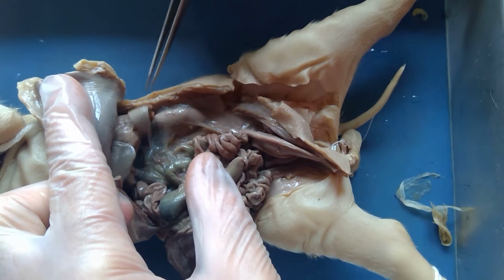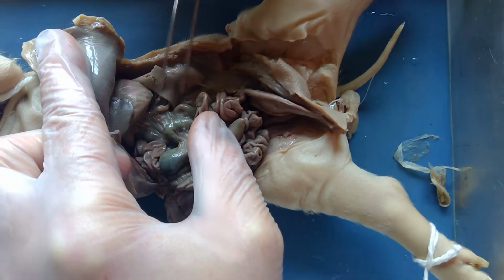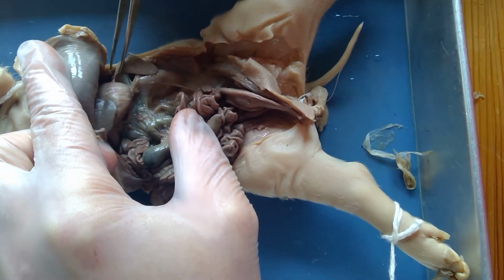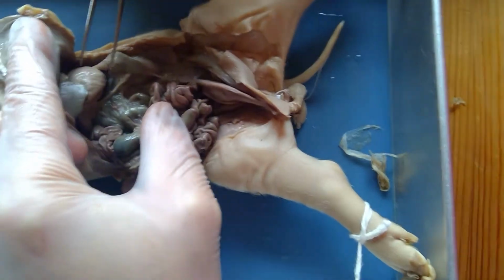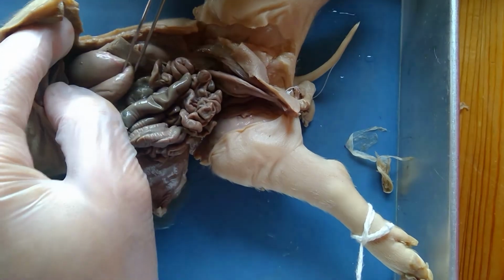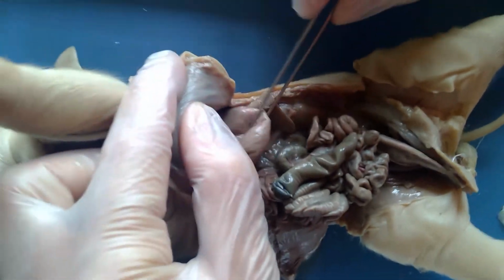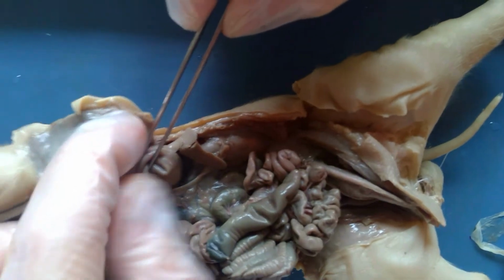So this little flap right here, that's actually not part of the digestive system, but it's the spleen. And the spleen is a lymph node, so it produces white blood cells, but it also will clean out dead red blood cells. And then right next to the spleen is this sac right here. That is the stomach. So if you look, Gabe, this is the stomach. It might be easier for you to see on the screen, Gabe. So there's the stomach. Stomach?